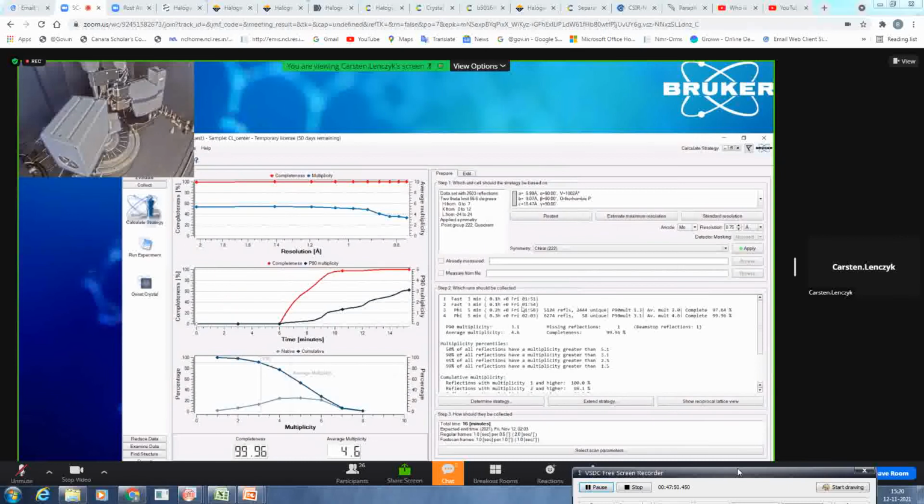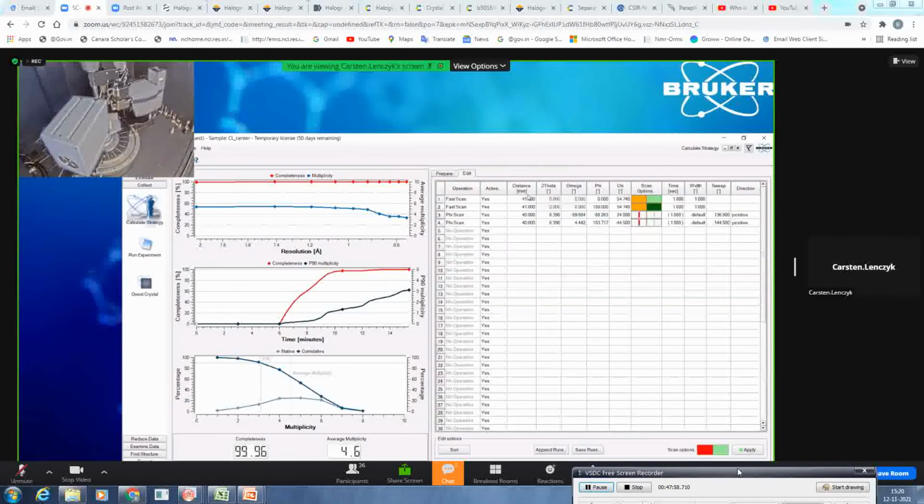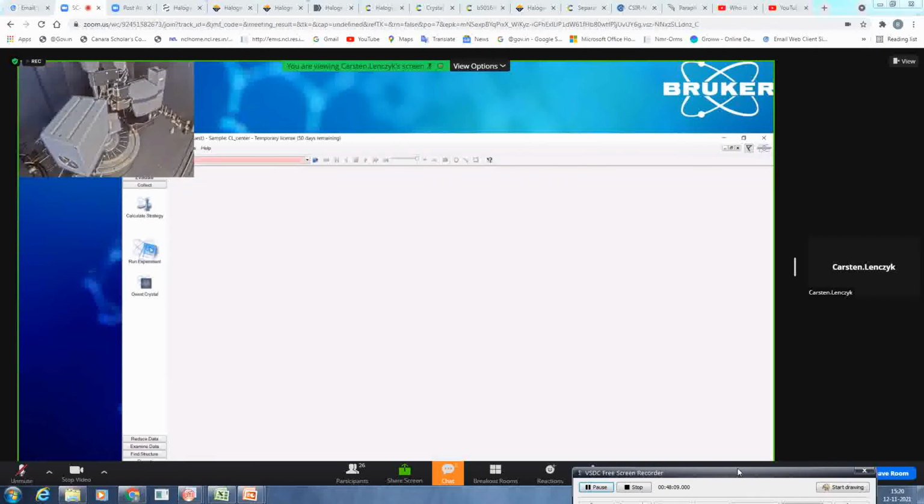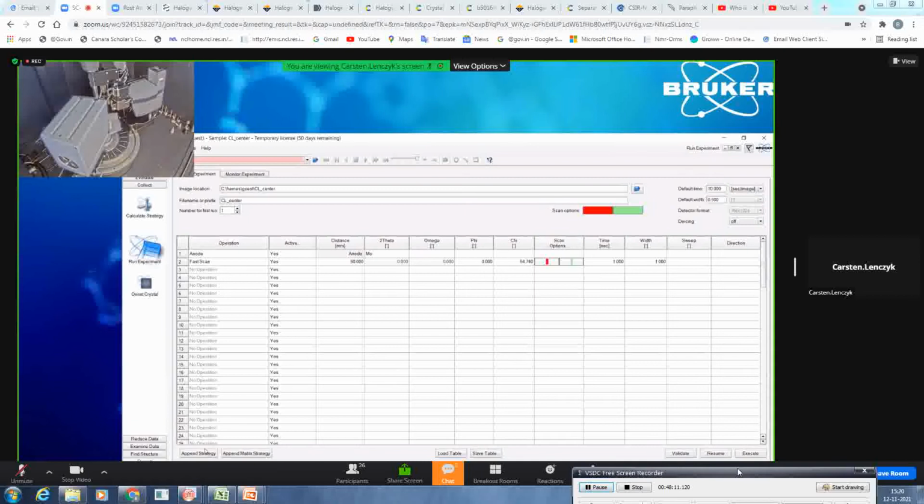We accept, and you see now also this plot has been updated. And you will see all the details again in this table here. So this is the determine strategy plugin. So what we will do now is we go back to the run experiment. And I will append. And finally, I will now come to the points of fast scans.